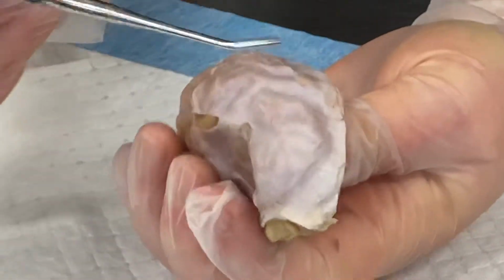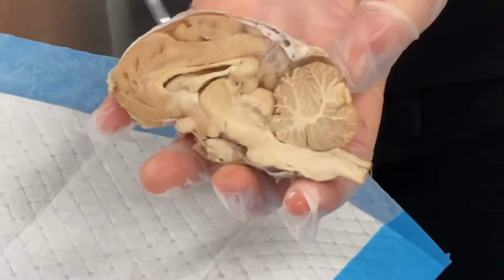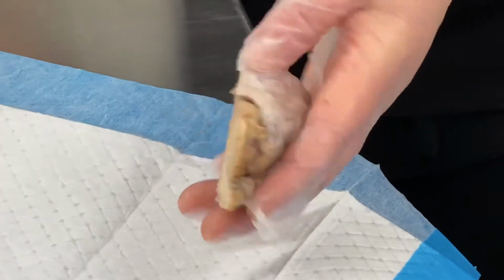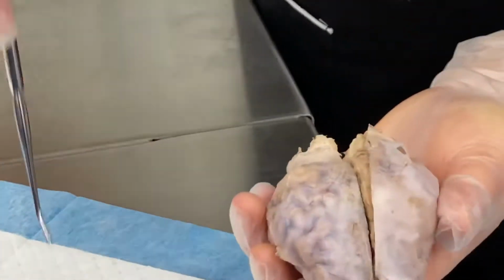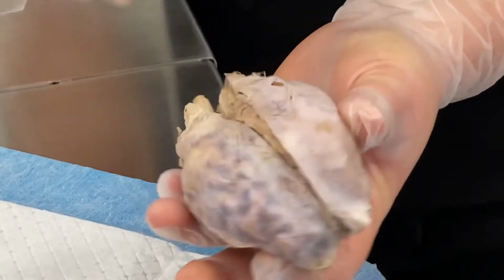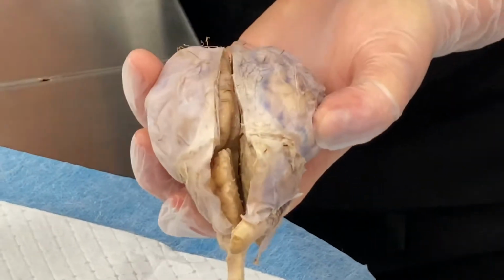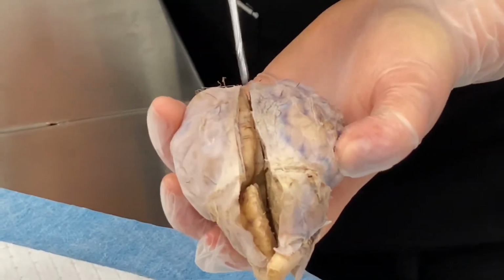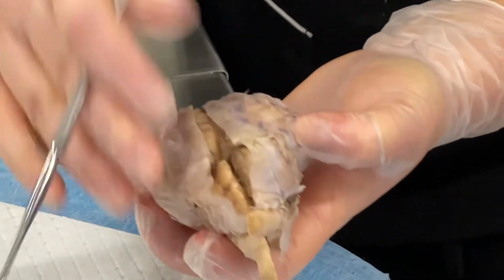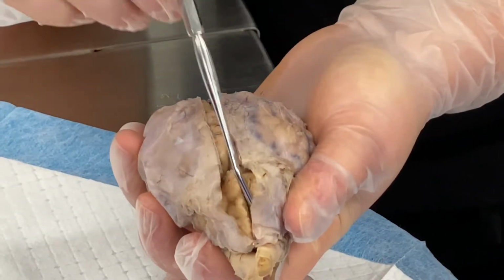Okay, awesome. So we have our brain here. Our big brain, this whole thing right here, this is called our cerebrum. Our little brain is called our cerebellum. It's this back here. You have two hemispheres, so we have our left and our right hemisphere. These are our cerebral hemispheres. This back here are our cerebellar hemispheres. The line that separates our cerebral hemispheres from each other is called our longitudinal cerebral fissure. The line that separates our cerebellar hemispheres is called our vermis.